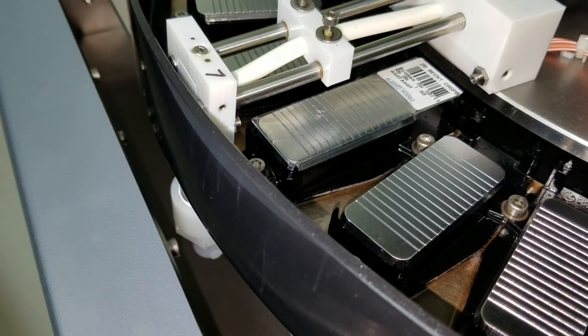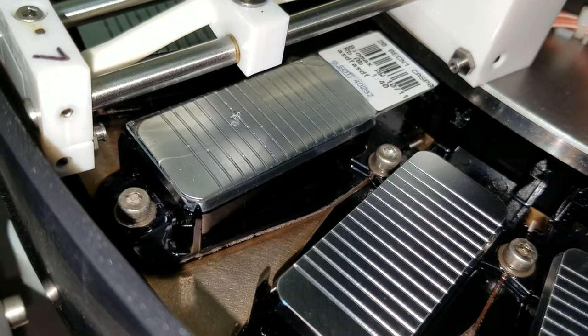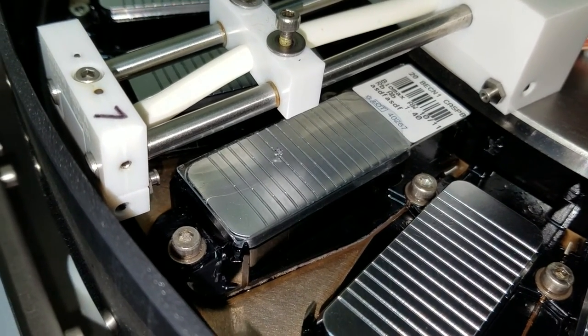Your nozzle — but again, you're going to be doing different protocols, so it's going to address things accordingly. So it's mixing right now. Oh yeah, it's very gentle. Yeah, we can do it again. Can you see the mixing?